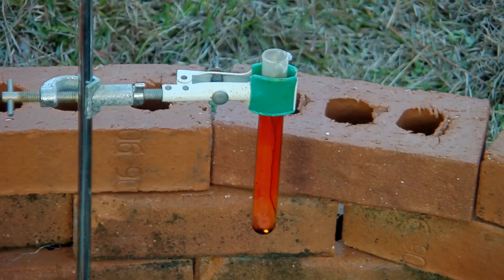Gorgeous. There's a little piece of aluminum still in there zipping around. It kind of looks like sodium on water, how it beads up and flies around on the surface.